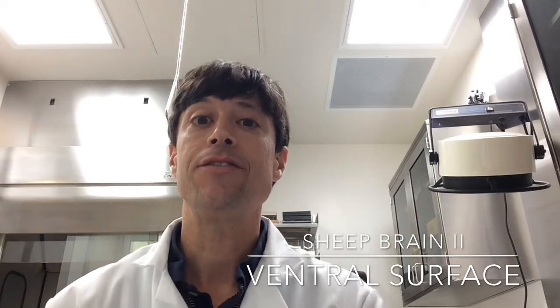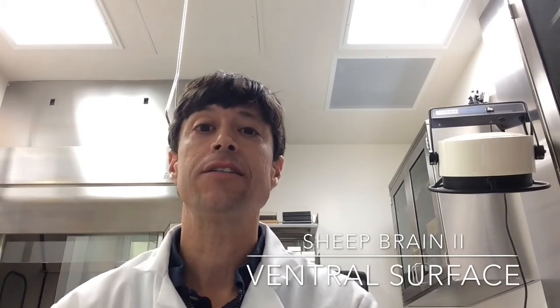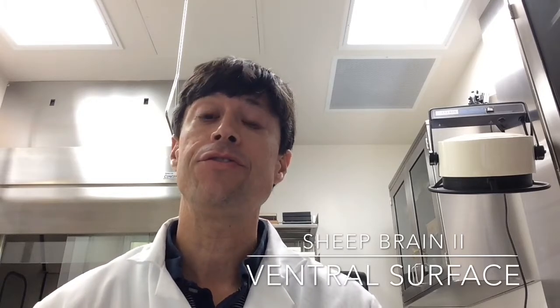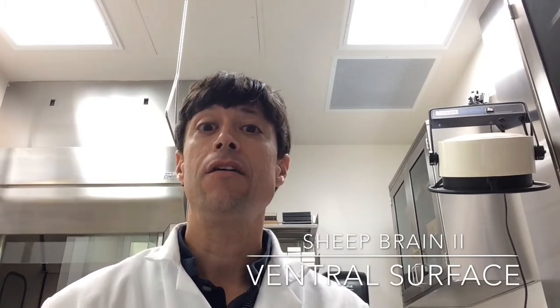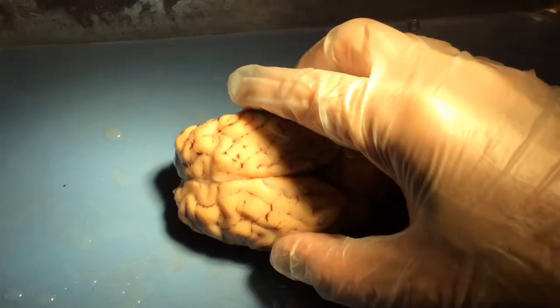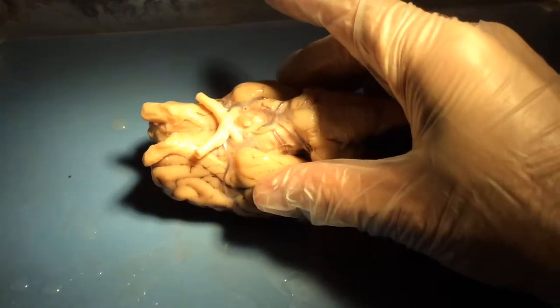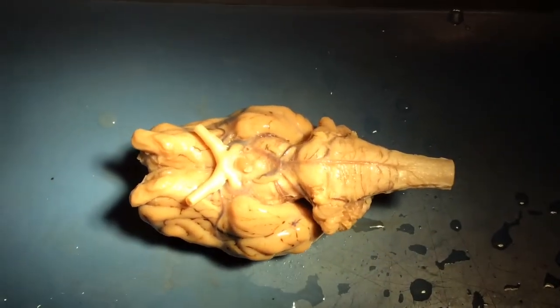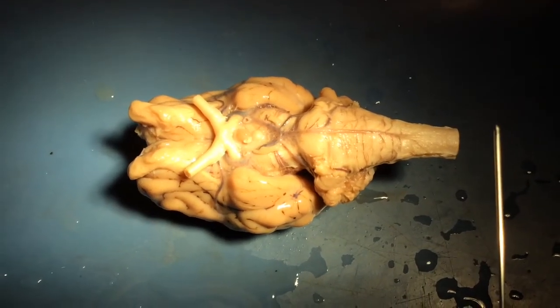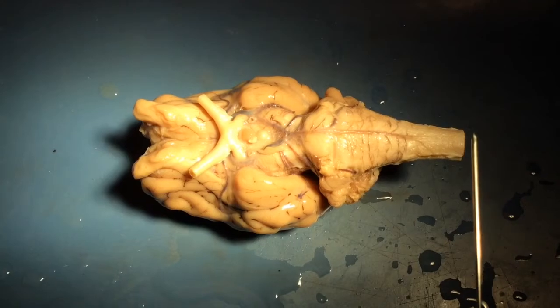This is the second in a series of videos on sheep brain dissection. In this video, we'll be looking at structures that you can see on the ventral surface, or bottom side, of the whole sheep brain. Okay, so here we have a whole sheep brain, but now it's dorsal side up, so I'm just going to flip it over so that it is ventral side up, so that we can look at some of the most notable features on the ventral surface of the sheep brain.